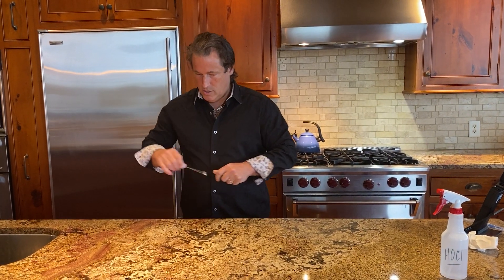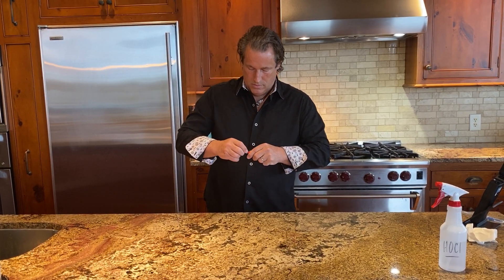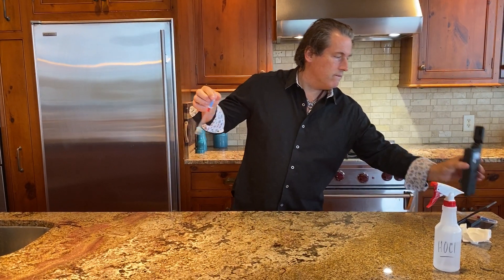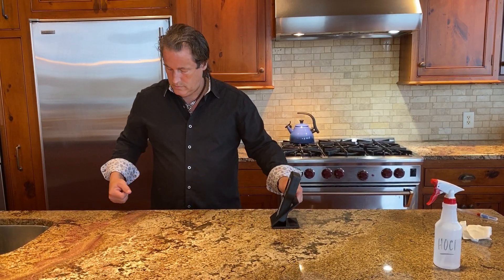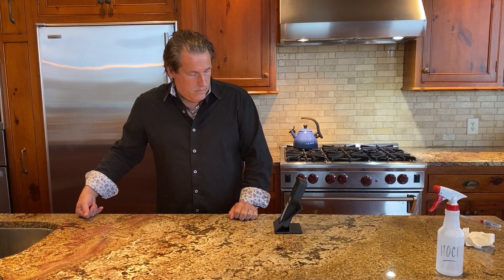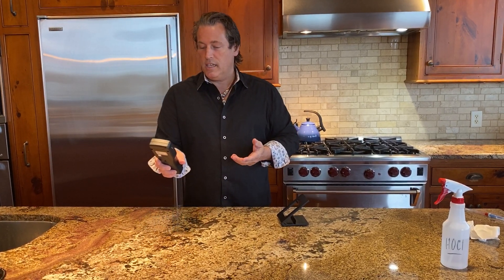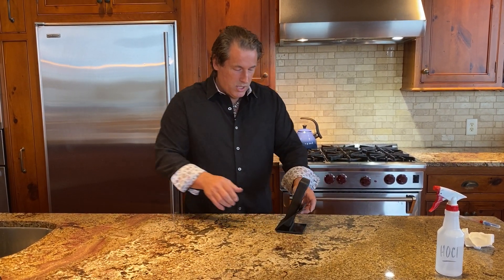Now let's swab this one. In 15 seconds — six. Cool, so bleach did help. The bleach absolutely helped — it always has. That's kind of a more standard result. If you can get under 10 you're doing amazing, and if you can get to six, that's great.